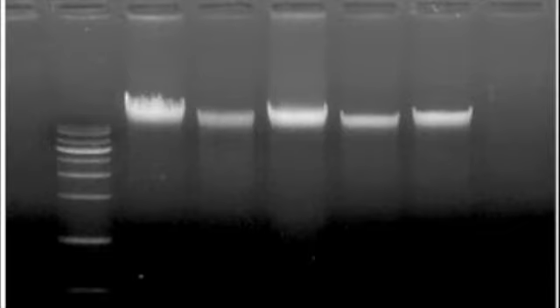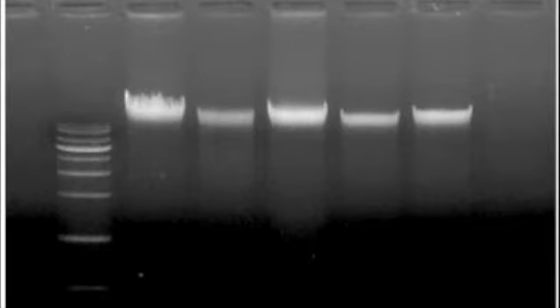I added the extracted DNA to a gel and powered it with 100 volts of electricity, and I know that I isolated DNA because I have single bands, like so. Now we can proceed with the restriction enzyme analysis of the evidence from the crime scene.